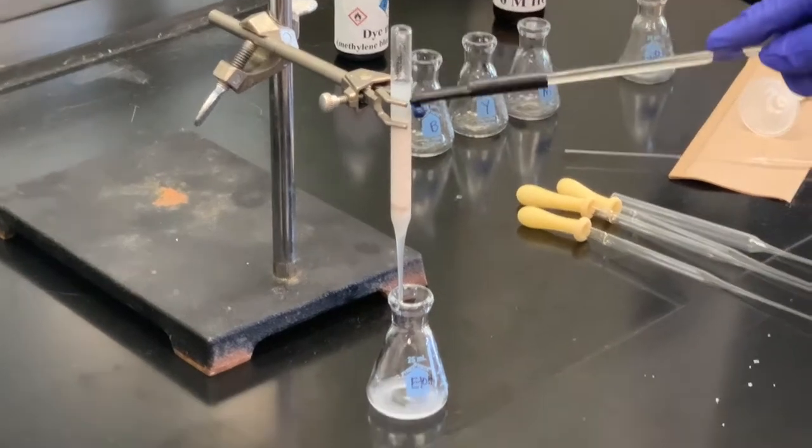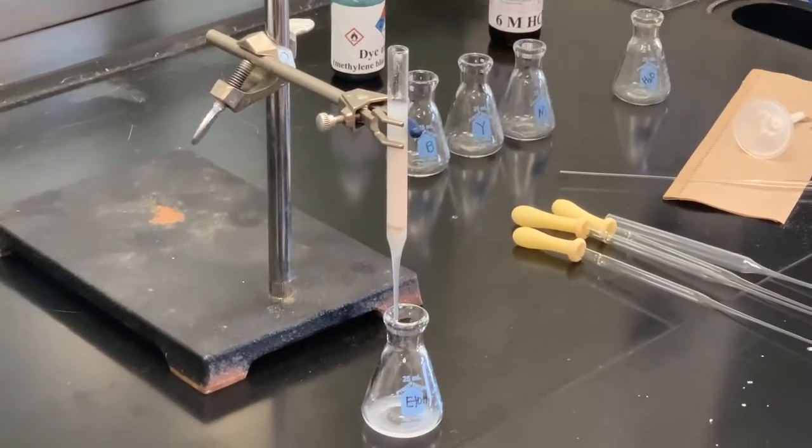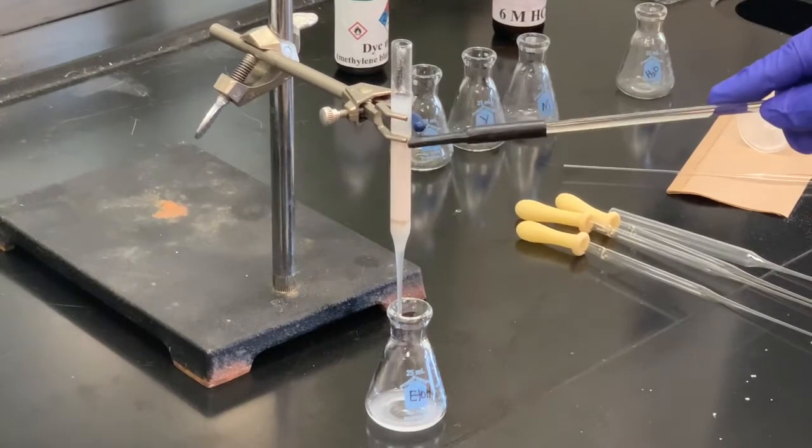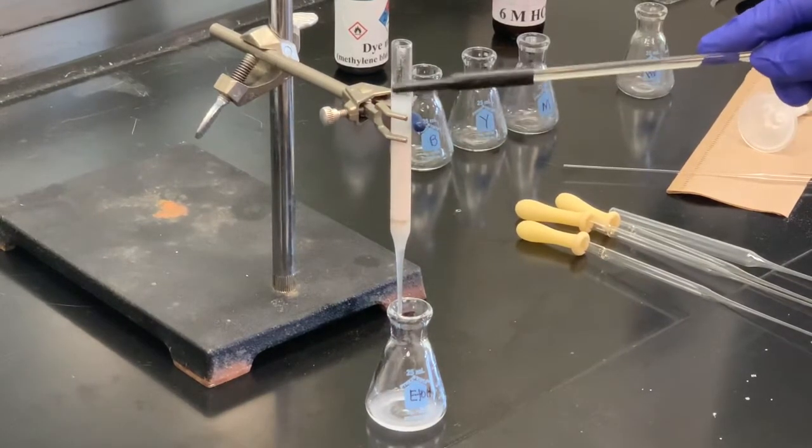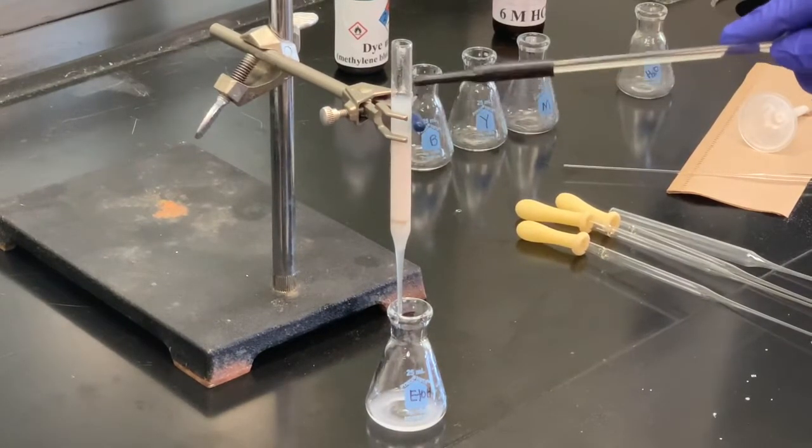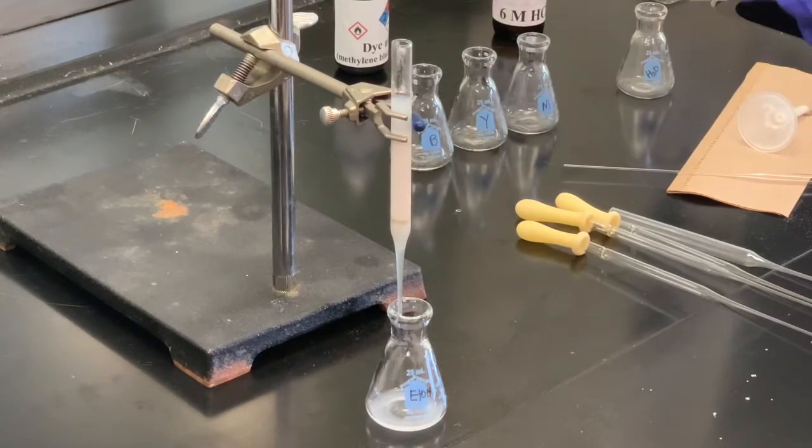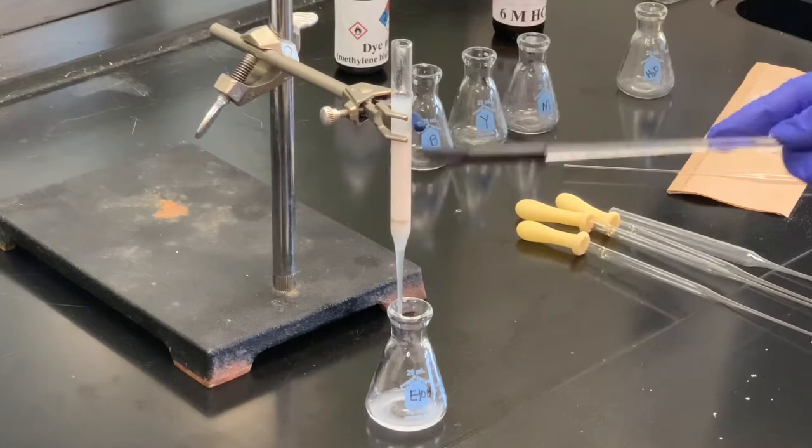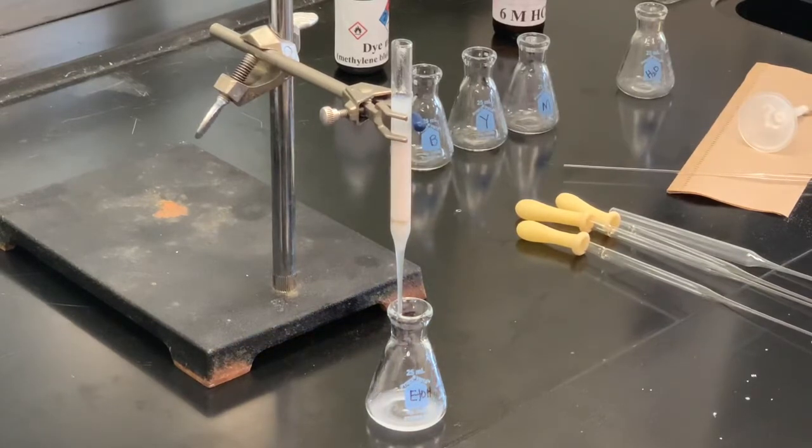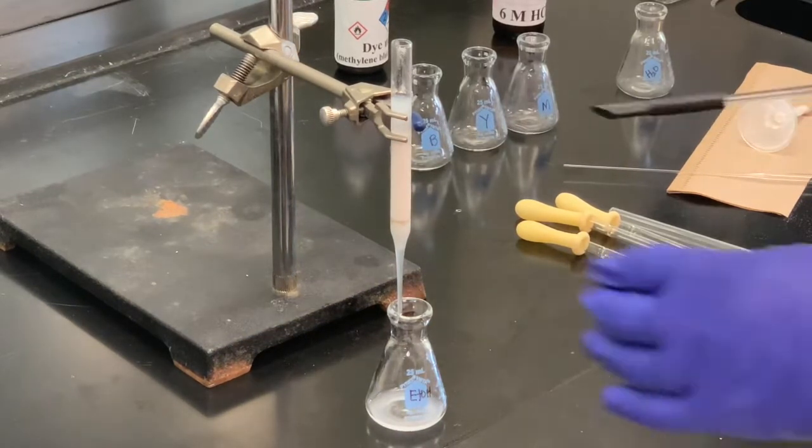I don't want to put it in there yet. I want most of that liquid to go down. We'll keep adding liquid as we need it, but it'll take a little bit of time for this to move down. But once it gets just a few millimeters above, I'll add some sand, a little bit more solvent. Again, anytime we add something, we need to pack it, and then we'll be ready to add our sample.